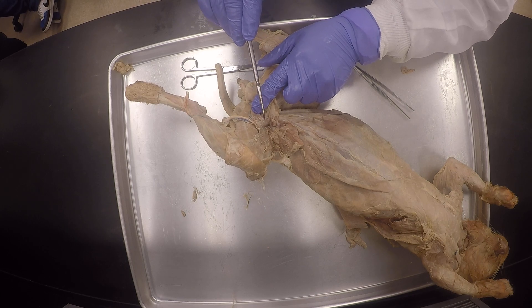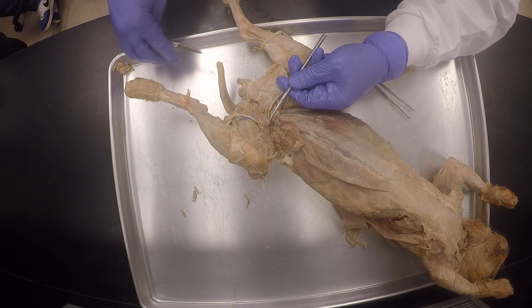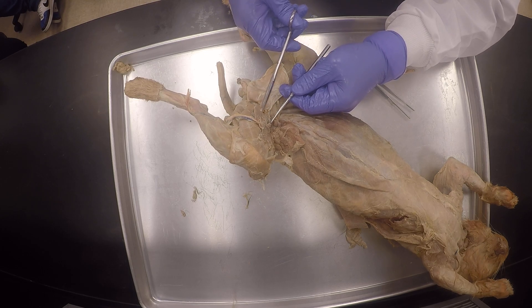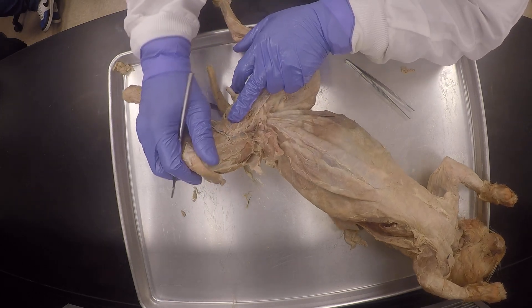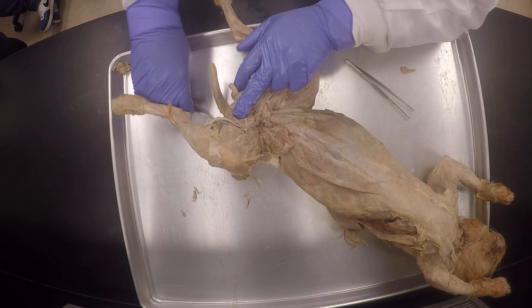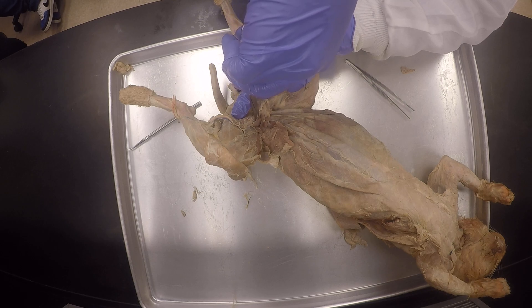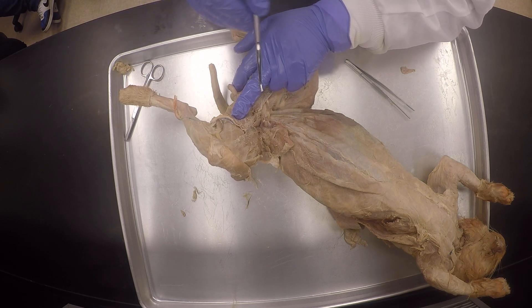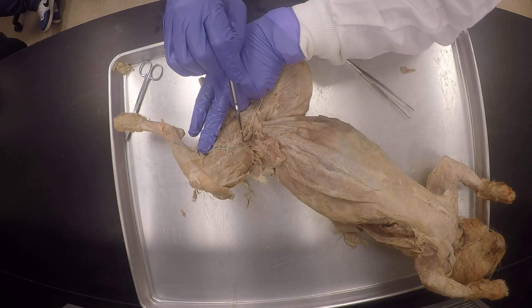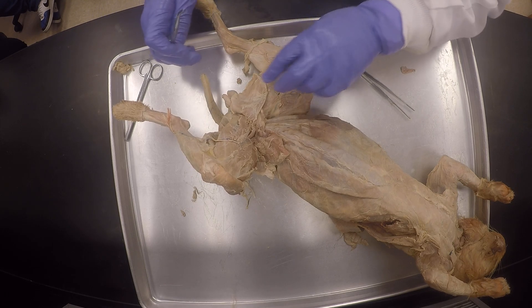So there's the line here with the adductor longus. It's very, very flimsy — it's easy to tear this adductor longus. For some reason sometimes these muscles get cooked up when they're preserved. So this long thin one is the adductor longus in the cat, still adductor longus in the human, because the human would have one long wide muscle called adductor longus. And then we have the adductor magnus, which is another big one, but we don't see it here.